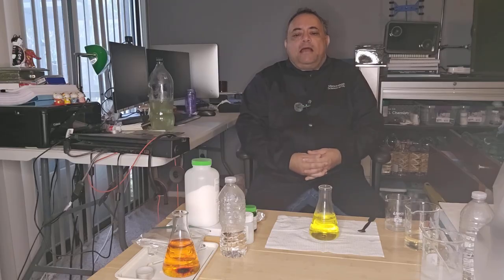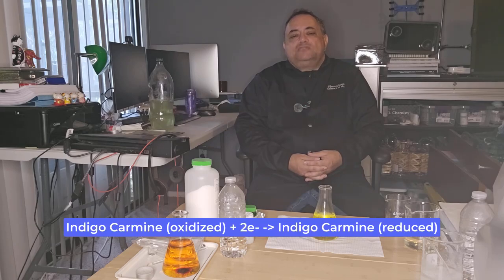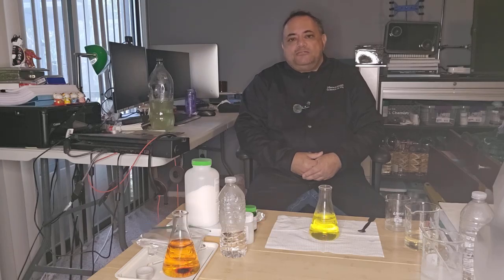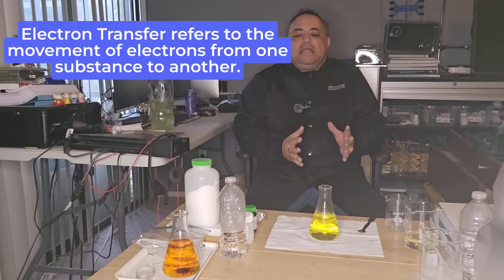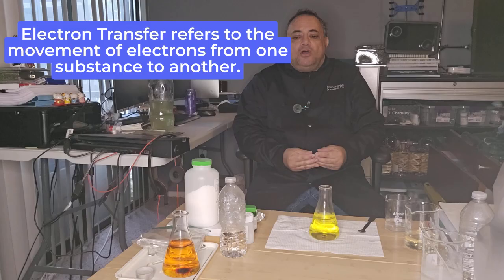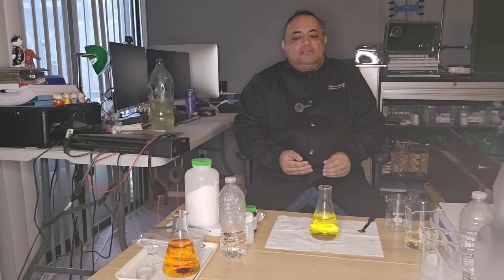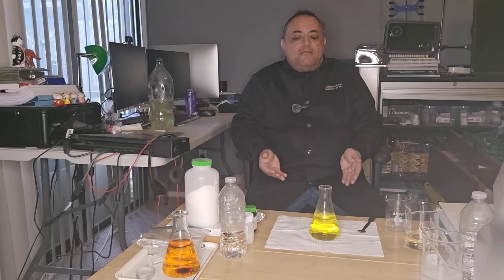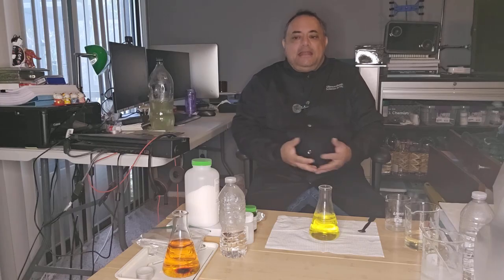So let's talk a little bit about the reduction-oxidation reaction. The indigo carmine reduction can be illustrated by the formula shown on your screen. The glucose oxidation can be illustrated by the second formula being displayed on your screen now. So, what is electron transfer? Well, in simple terms, electron transfer refers to the movement of electrons from one substance to another, which is the oxidizing agent. This transfer results in one species being oxidized, i.e., losing electrons, and the other substance being reduced, i.e., gaining electrons.